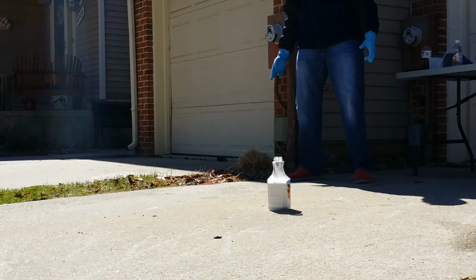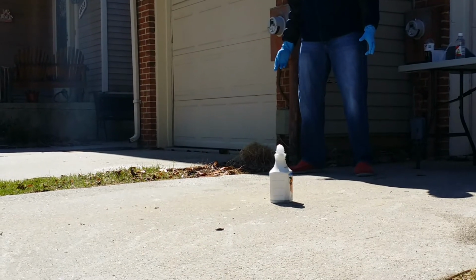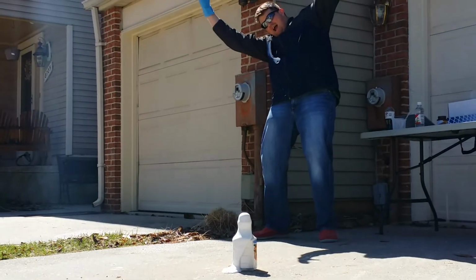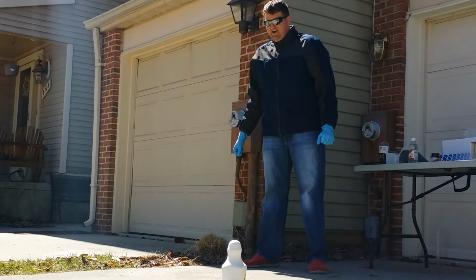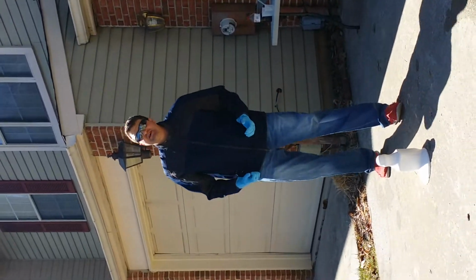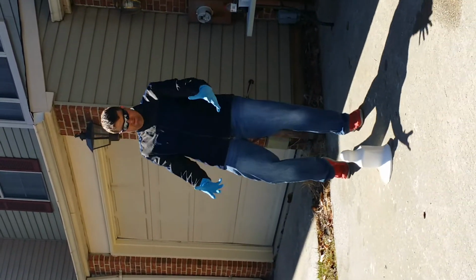It's starting to flow. It's coming. We got a little bit. Oh, well, that's not nearly as strong as I'd hoped, but here's the thing. When you go and you see this stuff on the internet, what they're actually using is a higher percentage base of hydrogen peroxide. And that's really where you're getting that extra massive foam flow.